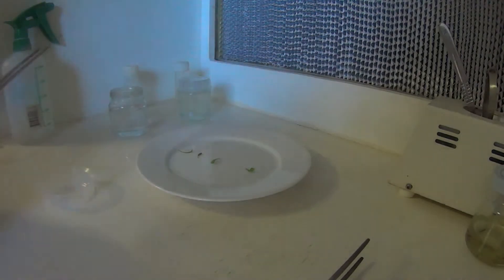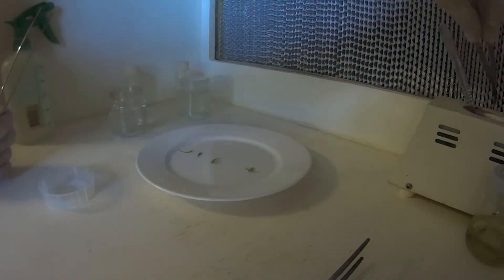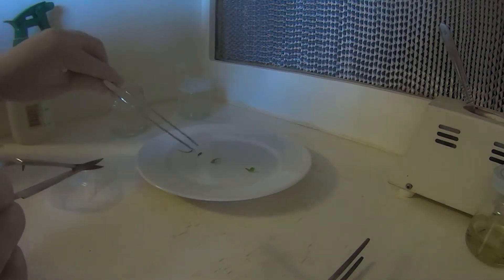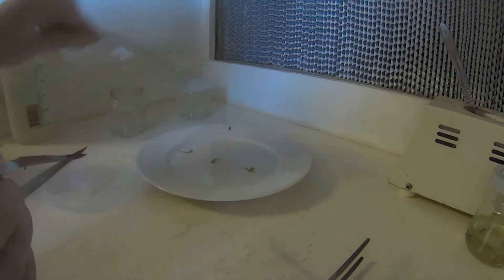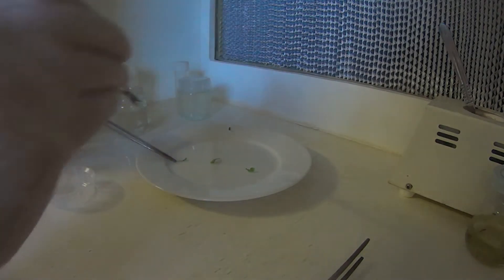All right, there's our bits. Looks like I've cooked a couple of them. It's a bit hit and miss. This one I wouldn't bother. I've left him too long in the bleach, so he's no good.